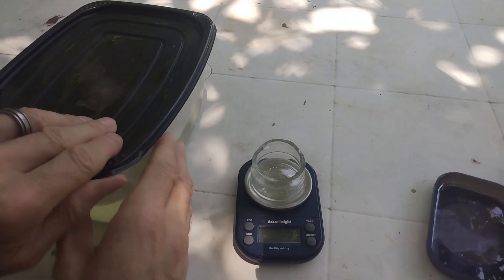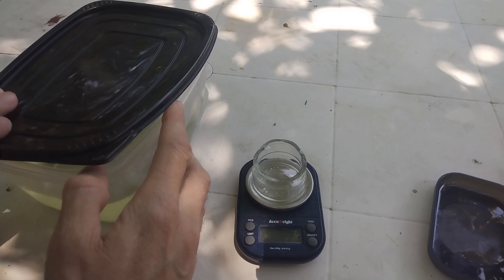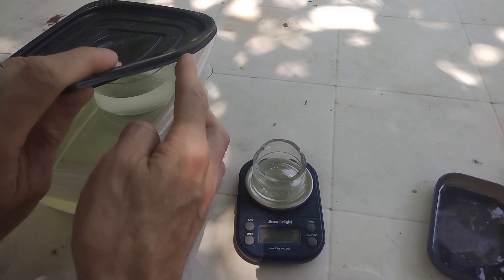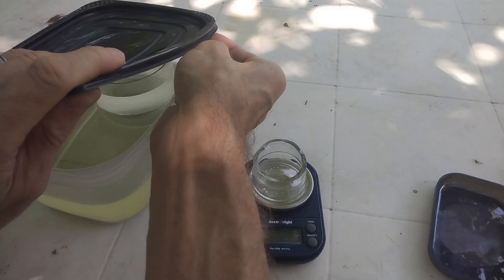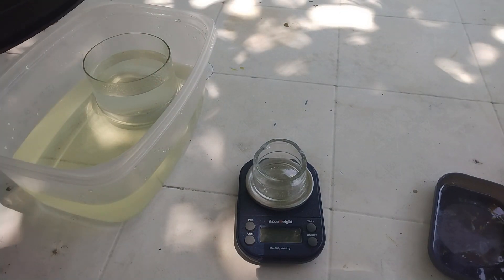I just came back from my trip. It has been about three weeks, so let's see what we got. I don't know if we can see on the camera, but there are some fumes coming out — that's perfectly normal, as hydrochloric acid is volatile.